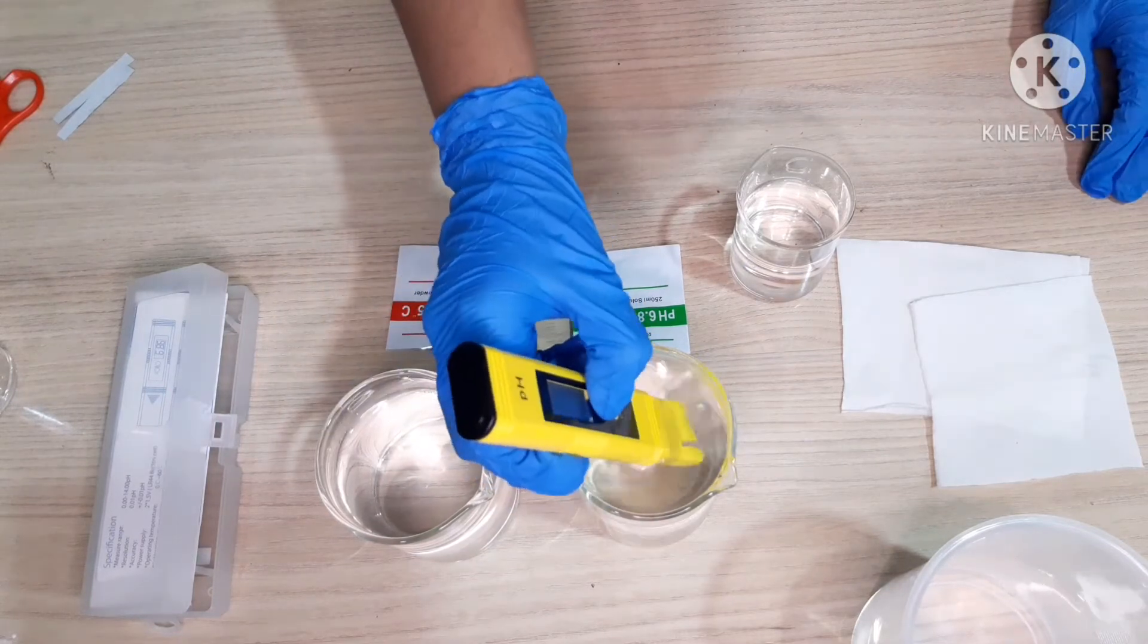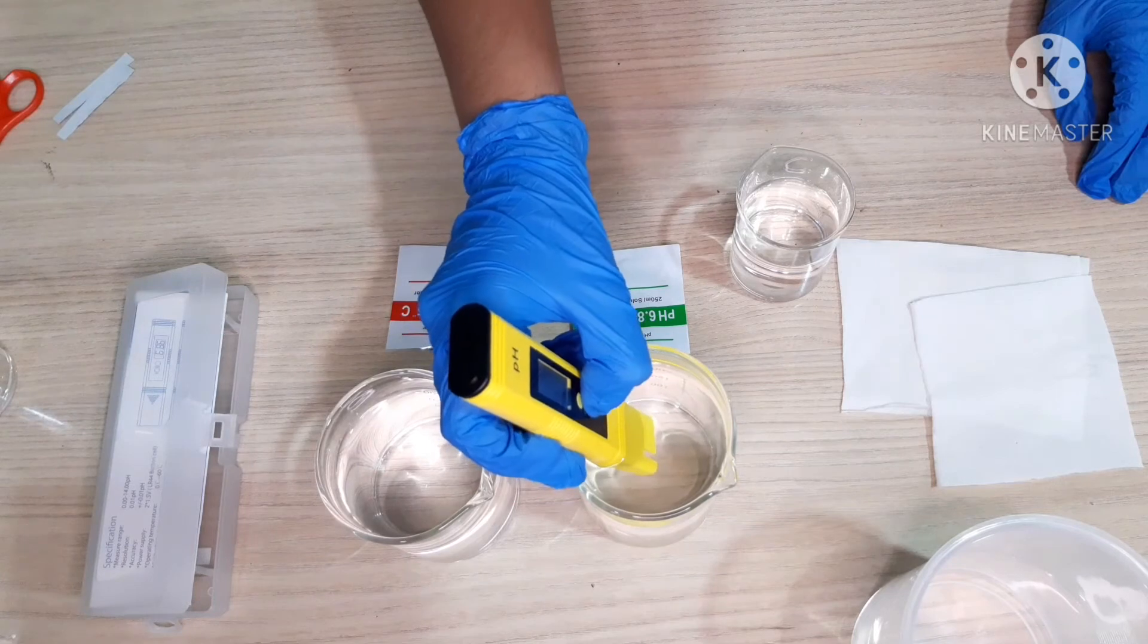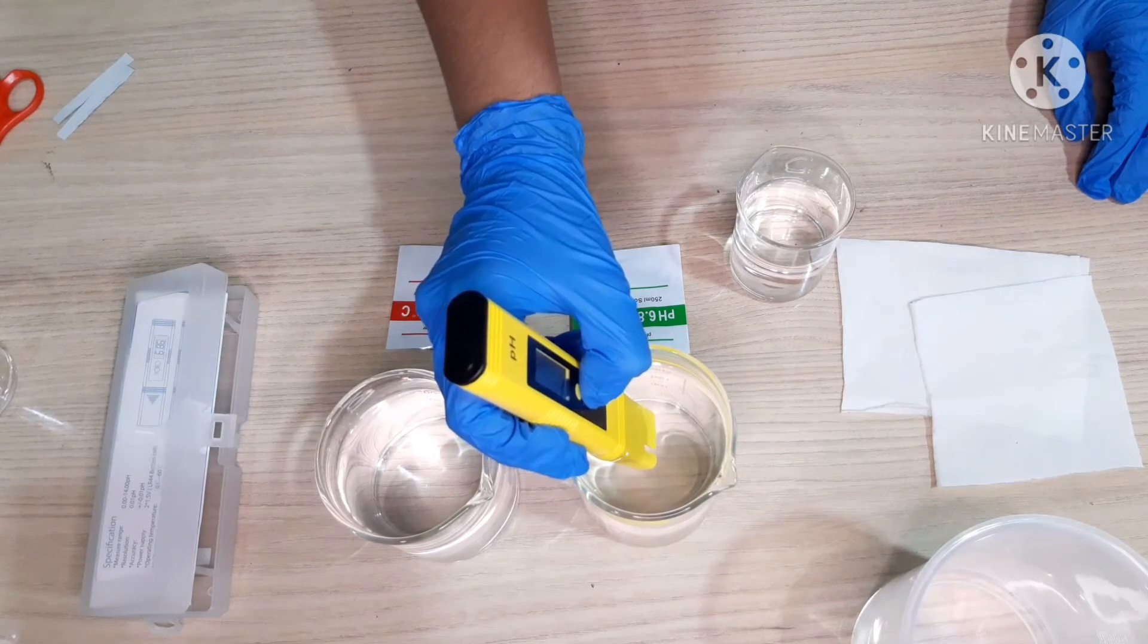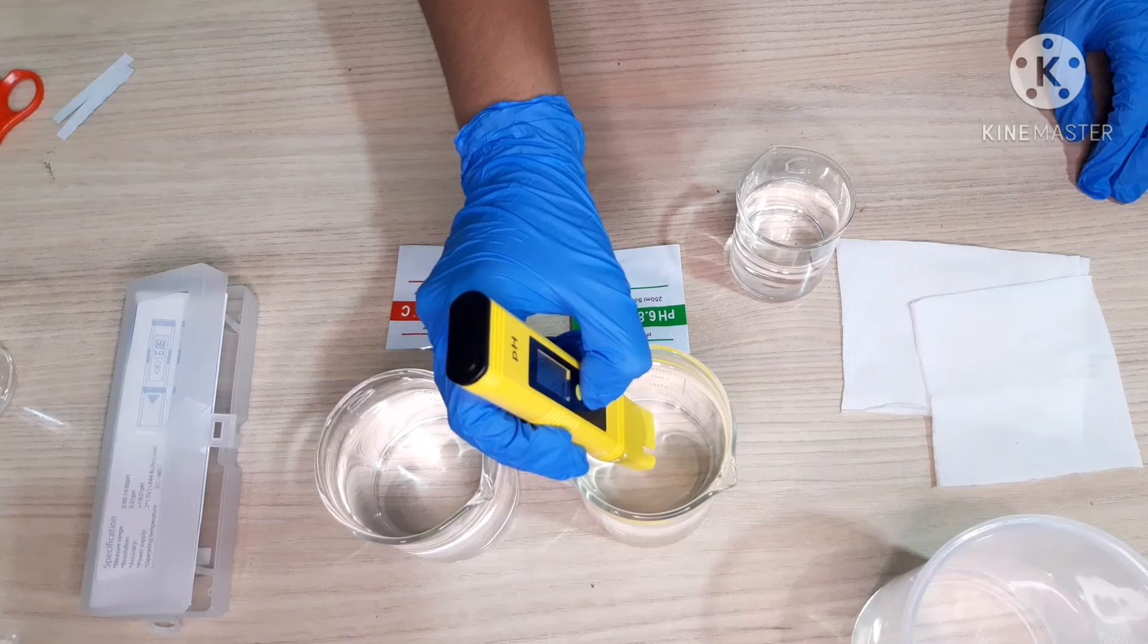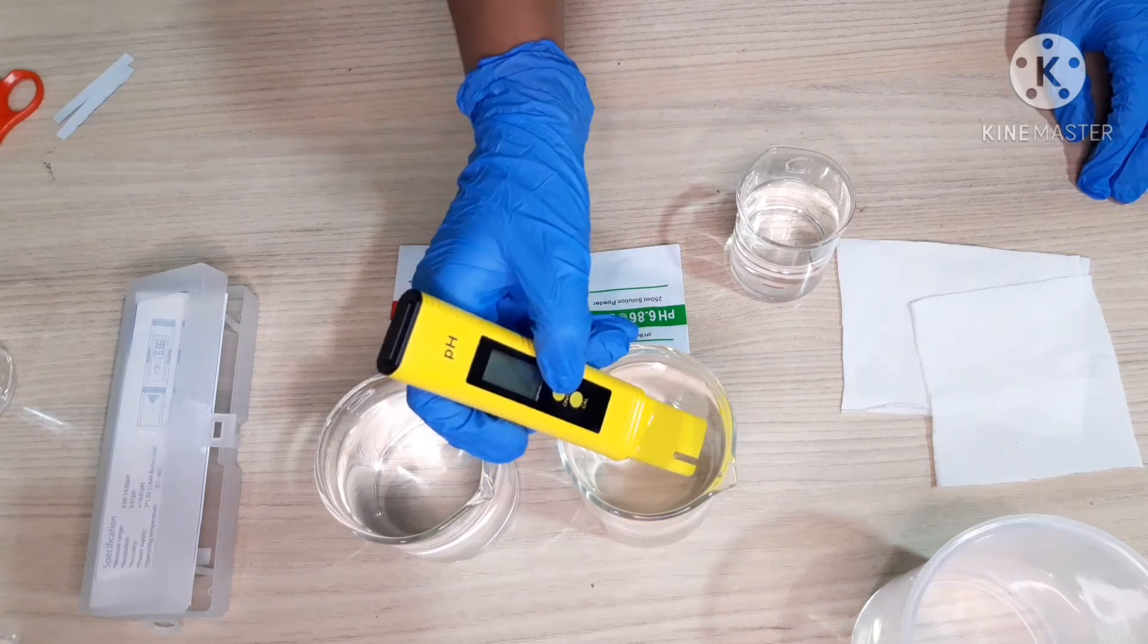Okay, I will put it in the first solution. And now, I will press calibrate for 5 seconds. It shows 6.86.